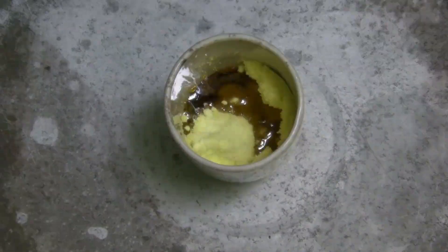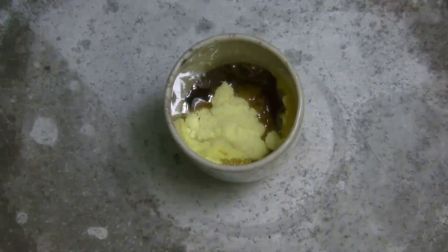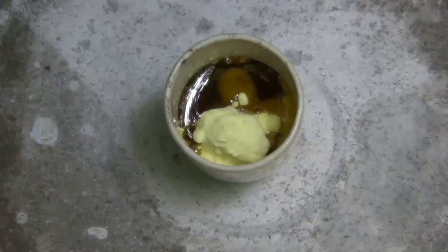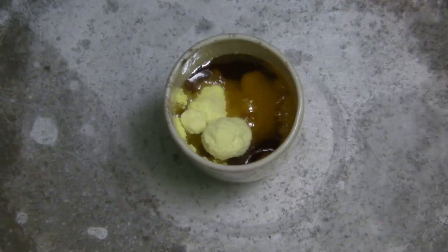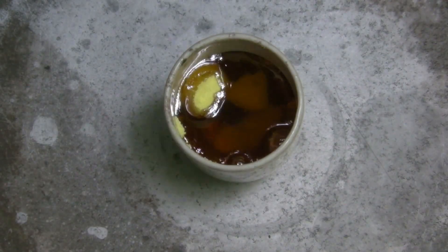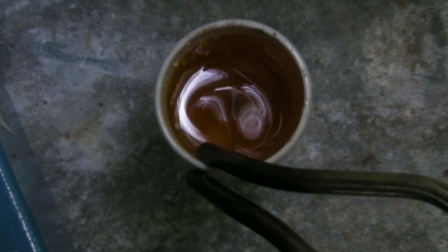When sulfur is heated carefully in a crucible, the following observation can be made when it cools down again. In the liquid, small needles are formed. When the liquid part is poured out, monoclinic sulfur is obtained.